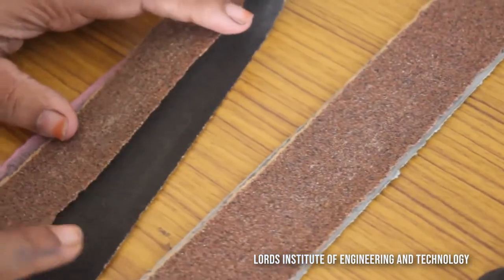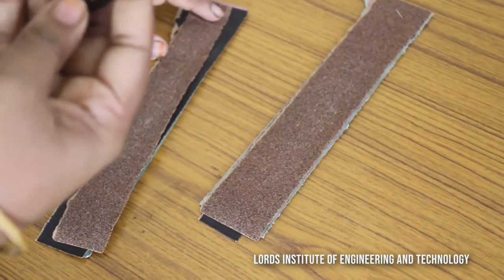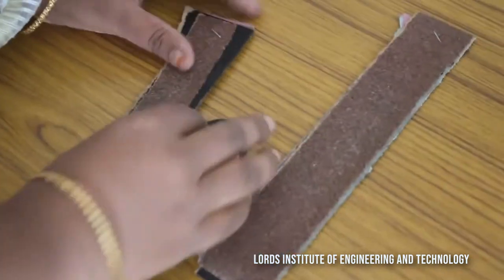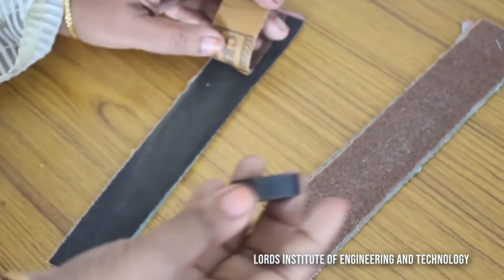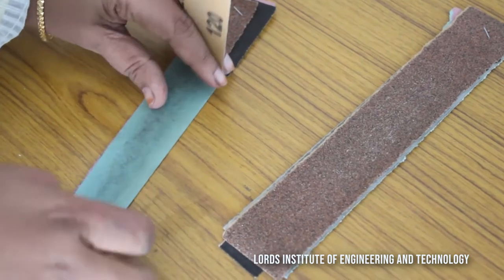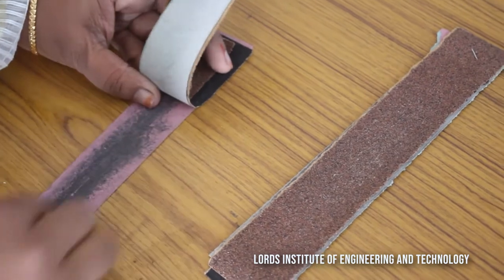We need to go from rough to smooth. The rough paper comes first, then black, then green, and then pink — the colors vary with respect to the grades. We do it on each paper for about two minutes. You will observe particles falling as the surface is refined. The last one is the pink color paper, and after completing all steps we are ready to view under the microscope.